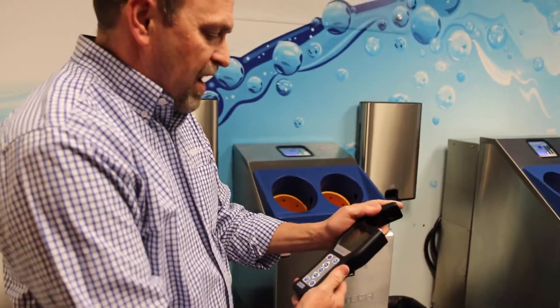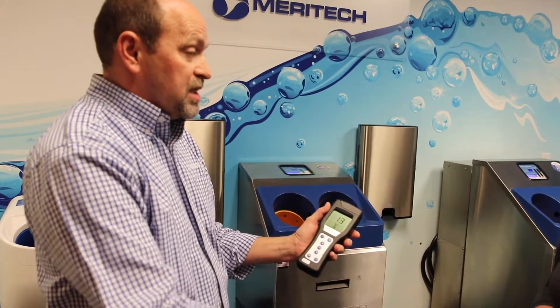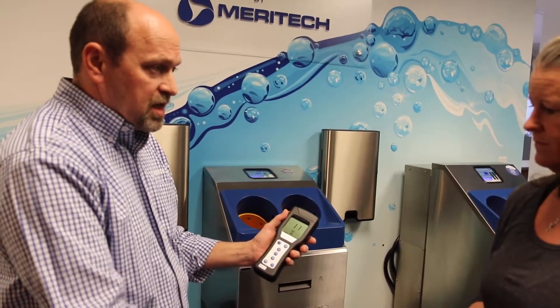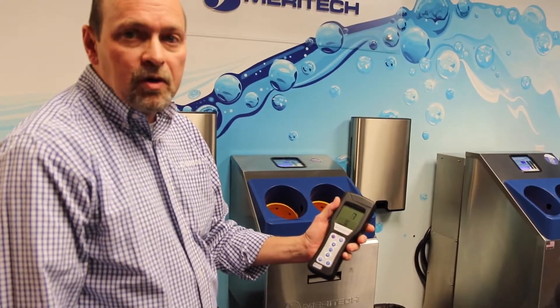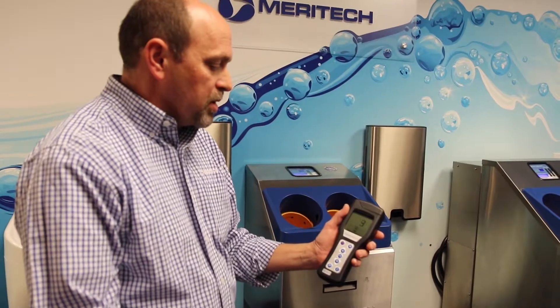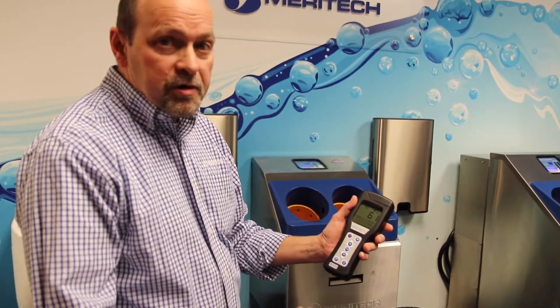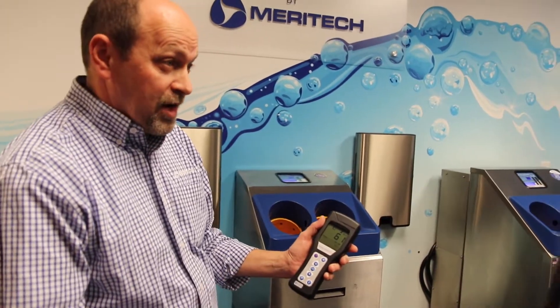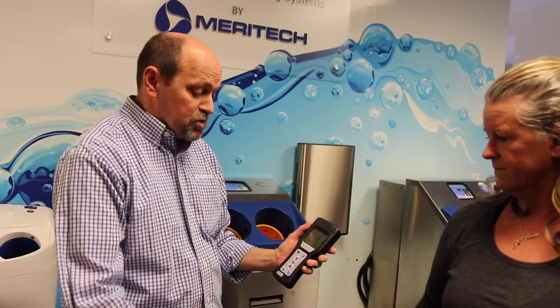It's a really simple way to validate and it only takes 15 seconds per test. Your pre-test took 15 seconds, your post-test takes 15 seconds. We're looking for a number below 100 or an 85 percent reduction, and we're at 61. So we got more than an 85 percent reduction and we are well below 100. That's showing you how well the hand hygiene event and the Cleantech system is washing your hands.